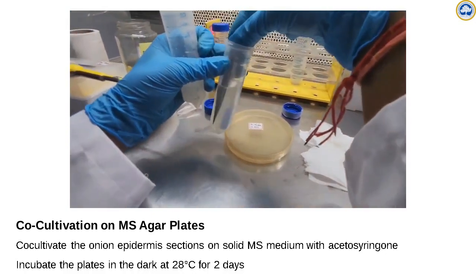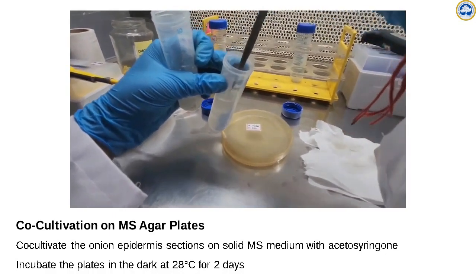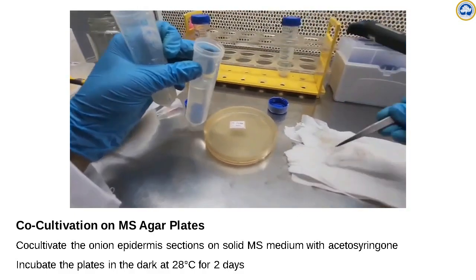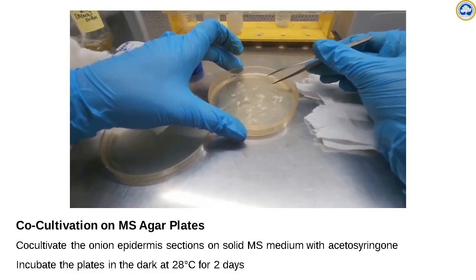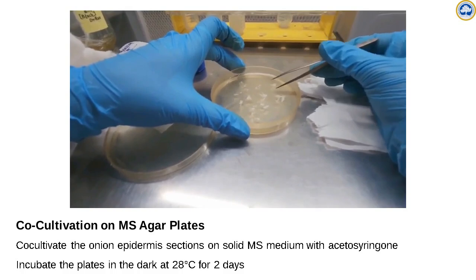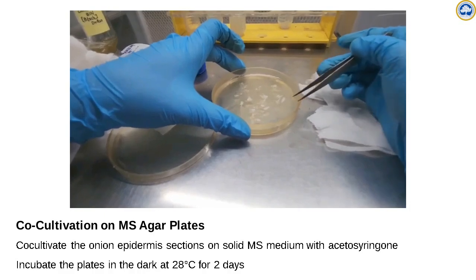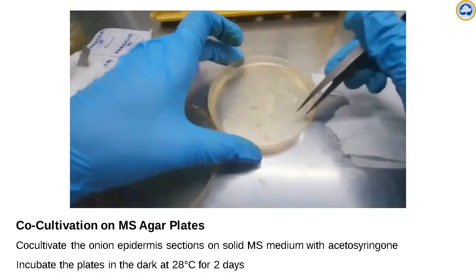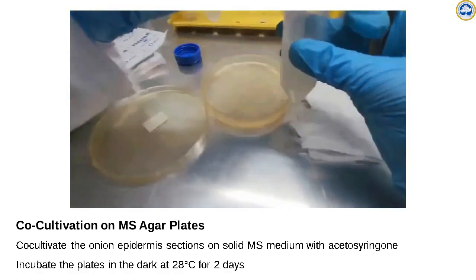We pull out the onion epidermal cells infected with agrobacterium, rinse them, and place them on sterile tissue to remove excess moisture, and then we place them on the MS plates. We incubate these for 24 to 48 hours in the dark at 28 degrees Celsius.